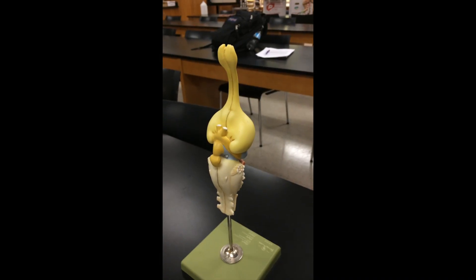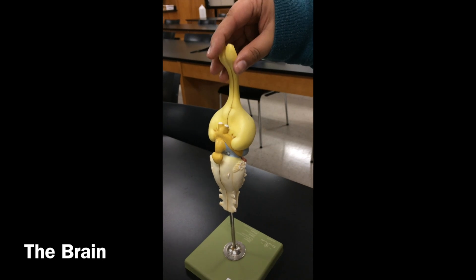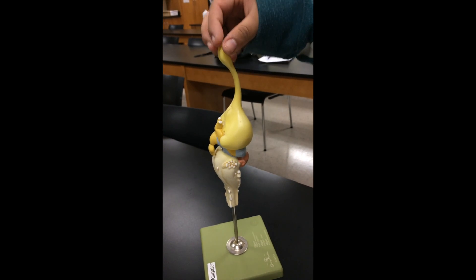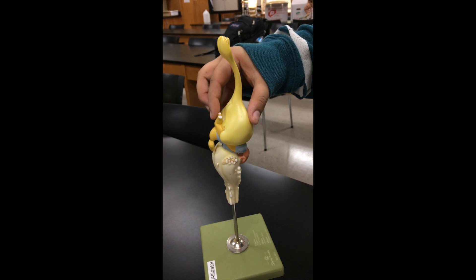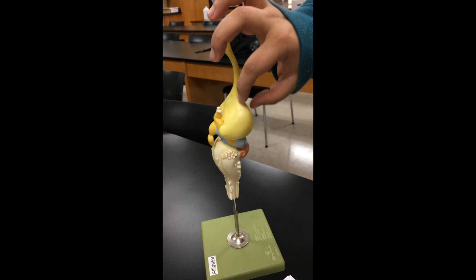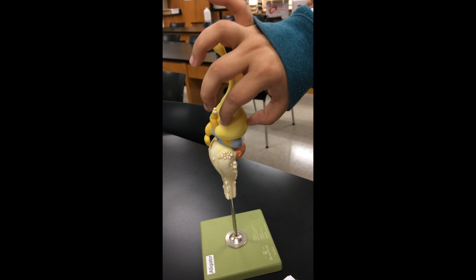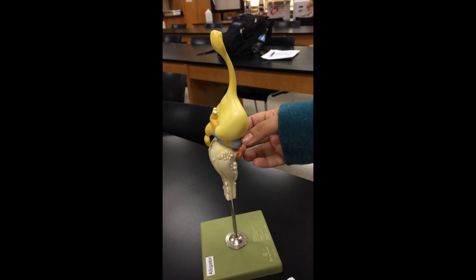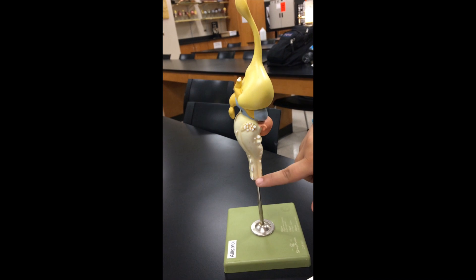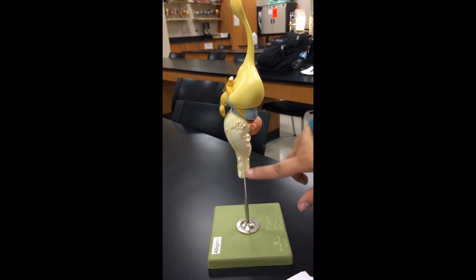This is a brain from an alligator, but it's going to be the same as a turtle. Here we see the olfactory bulb with the optic nerve right here. This giant bulb is the cerebrum, then here is the cerebellum, and then this long structure right here is the medulla oblongata.